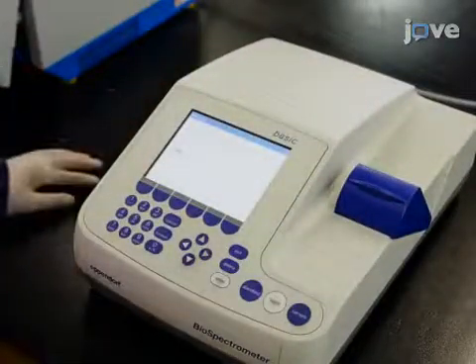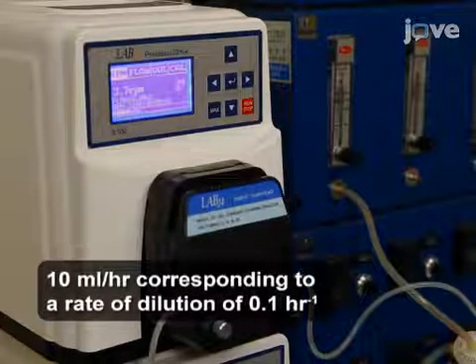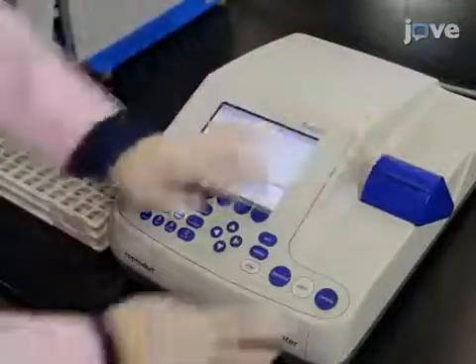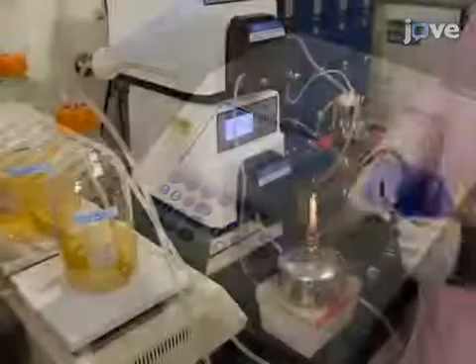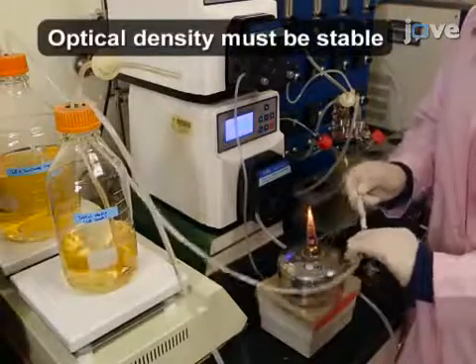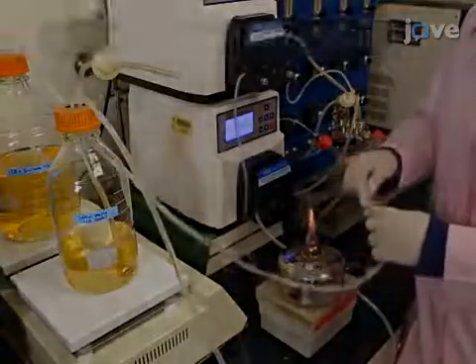Check the optical density at 600 nanometers of the culture from the outlet tubing, then start the inlet pump. Check the optical density at 600 nanometers from the outlet tubing every 24 hours. After operating the chemostat for 96 hours, which is a 9.6-fold turnover, exchange the reservoir to the lowest concentration of high stress medium.